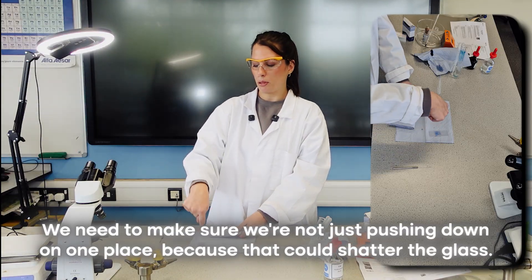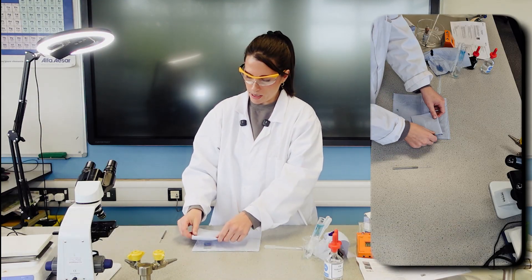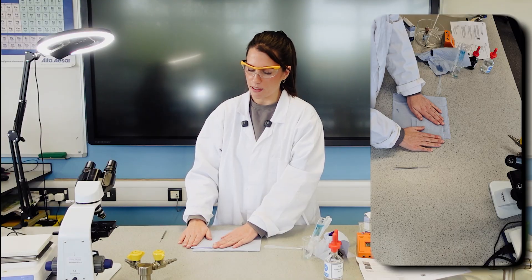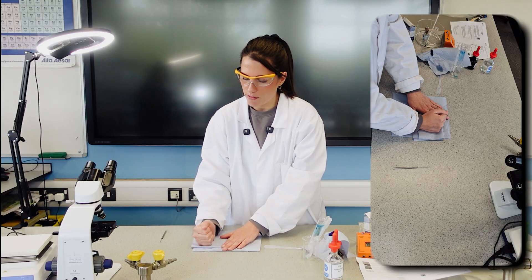We need to squash so we get that single layer of cells. But we need to make sure we're not just pushing down in one place because that could shatter the glass. So I'm going to place this on top.